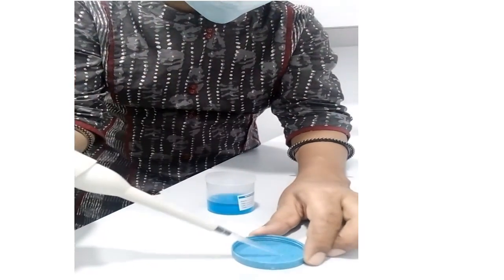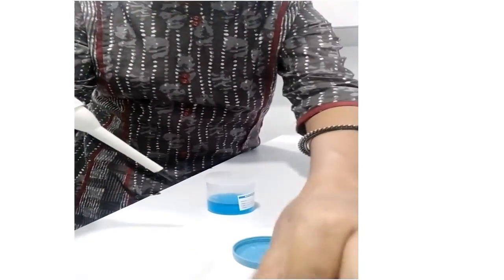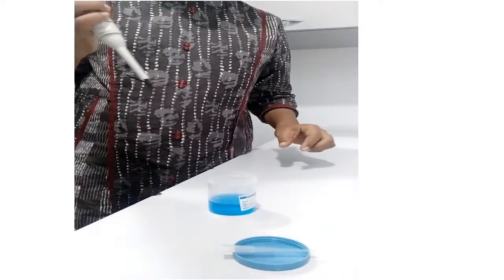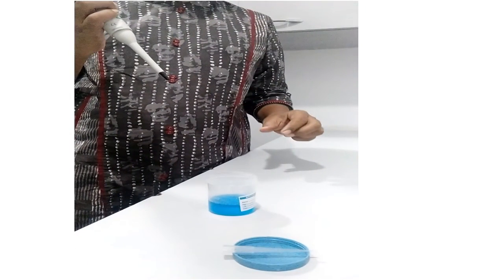How to remove the tip from the tip cone? I have to press the tip ejector. Here, I have pressed the tip ejector and the tip has been removed.